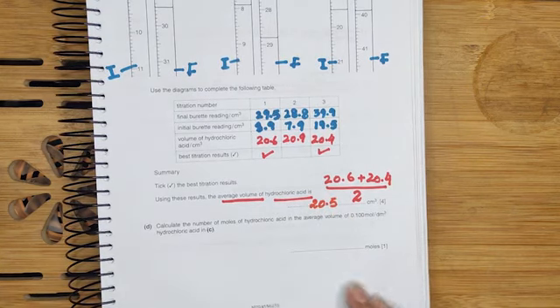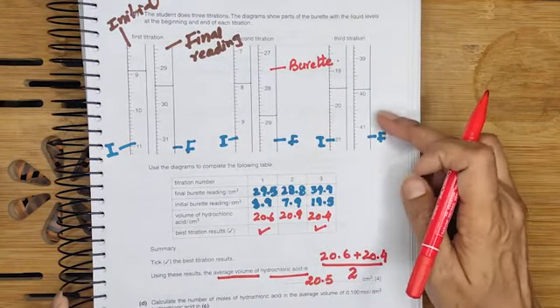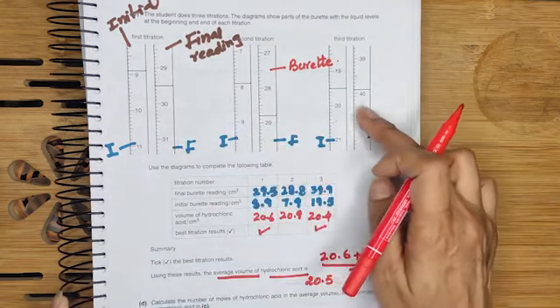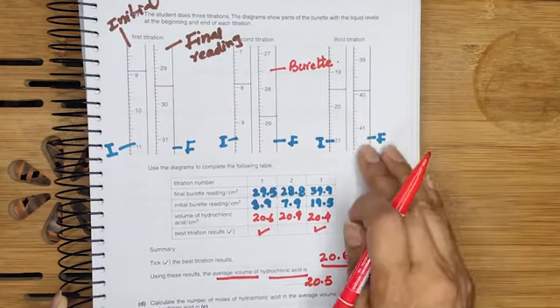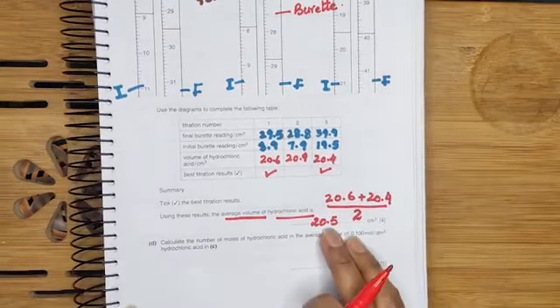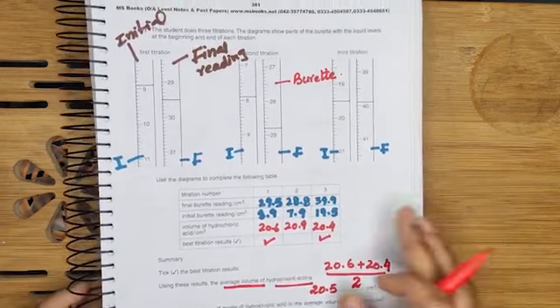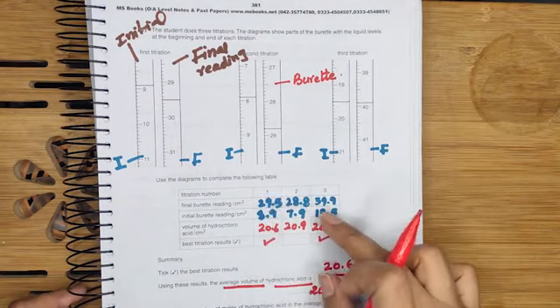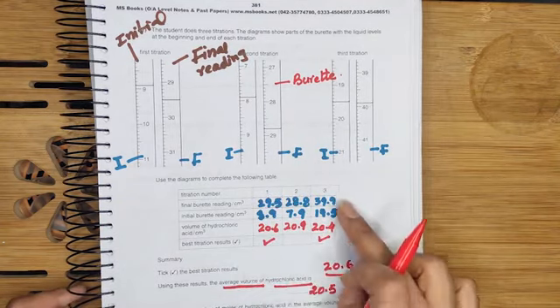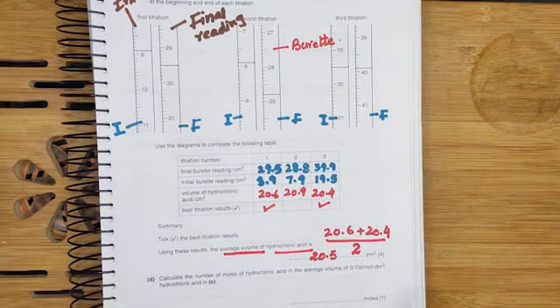So this is the way through which you have to fill the table after reading the volume of the solution, the volume of the acid or base, whatever is given in the burette. The answer after getting the average volume is 20.5 centimeter cube. This is the way through which you will get the burette readings, and you have to record the readings in this table, and you will get the difference between these volumes and get the best results to get the average volume of hydrochloric acid used.